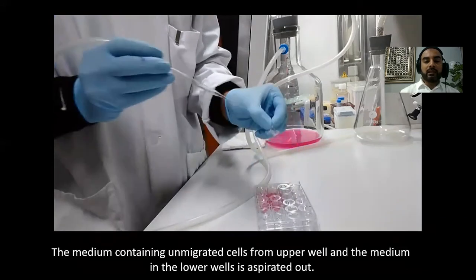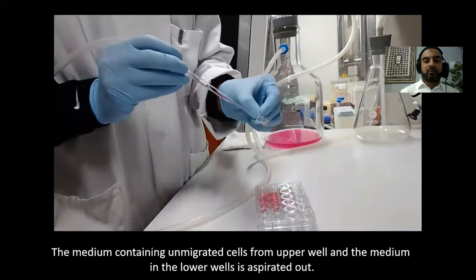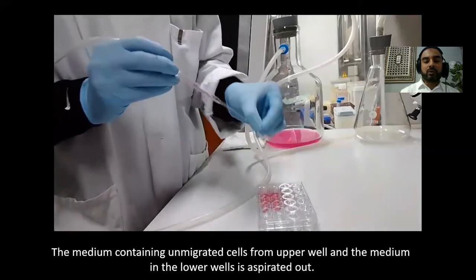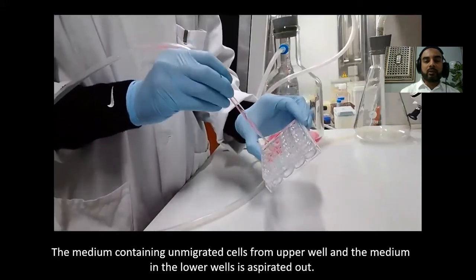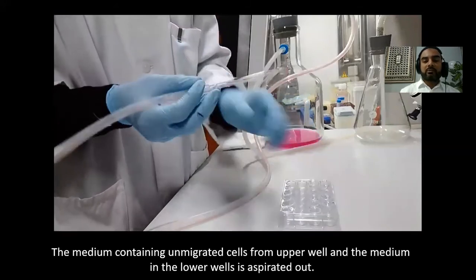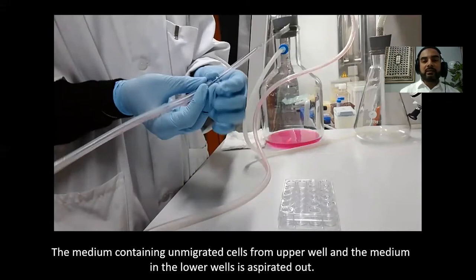After incubation, we take out the inserts. First, we carefully aspirate the medium from every migration insert — gently, with lower pressure, so you do not push the cells back. Then we aspirate the medium from the lower wells as well, since we no longer need it. The next step is to use a cotton bud to carefully wipe the unmigrated cells from the top of the insert.